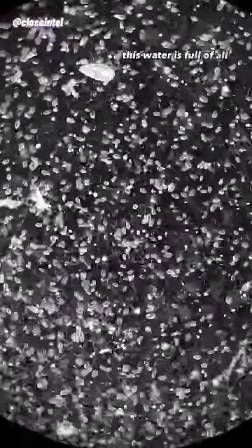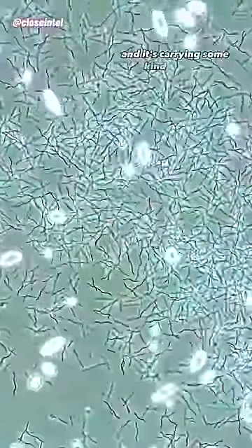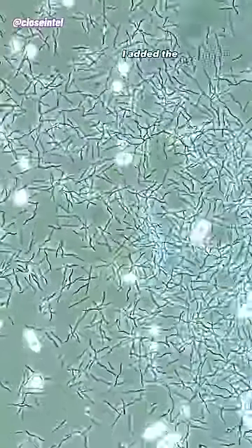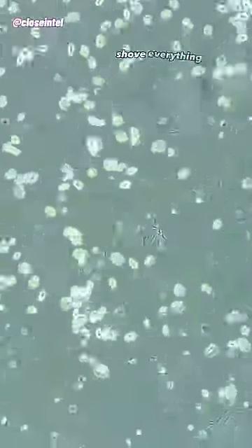As you can see, this water is full of all kinds of microbes and it's carrying some kind of spiral-shaped bacteria inside. I added the hydrogen peroxide here and you can see its impact shove everything out of the way.